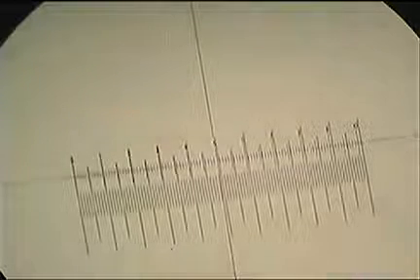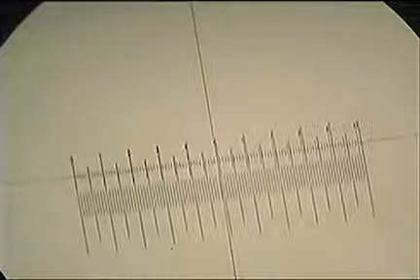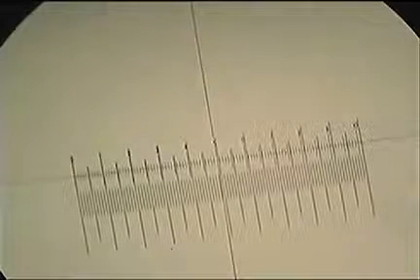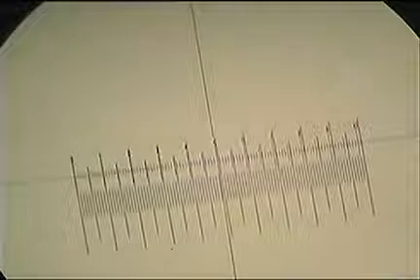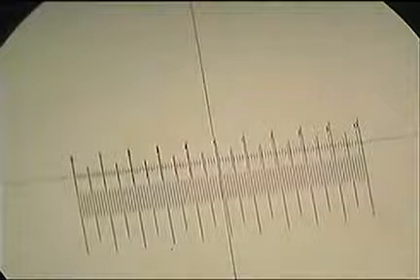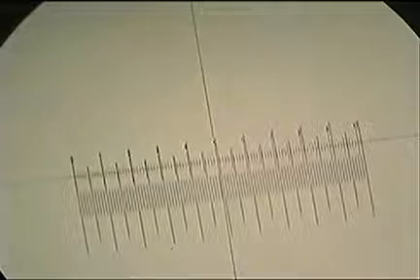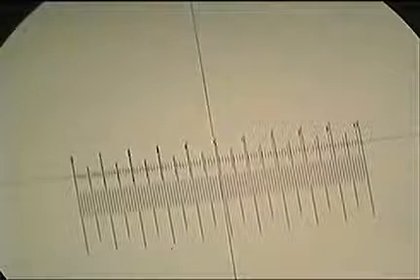So we'll write that down, 9.6 for my eyepiece. On the stage micrometer, what distance do we have there? Well, looking at that, we've got 9 of our larger units, so those are 0.1 each. So we've got 0.9, and then basically 5 of the little units to the slightly shorter line would be 0.95. The whole thing is 1 millimeter, so coming back 5 of the smallest units is 0.95 millimeters.